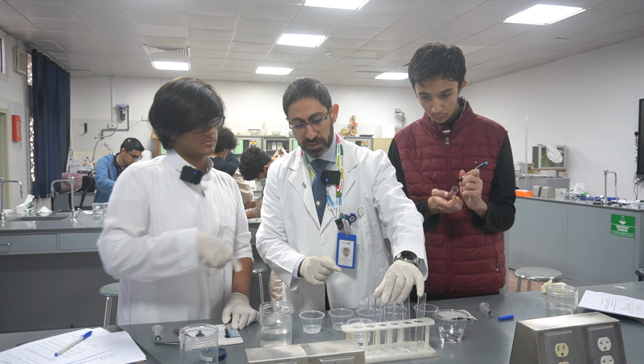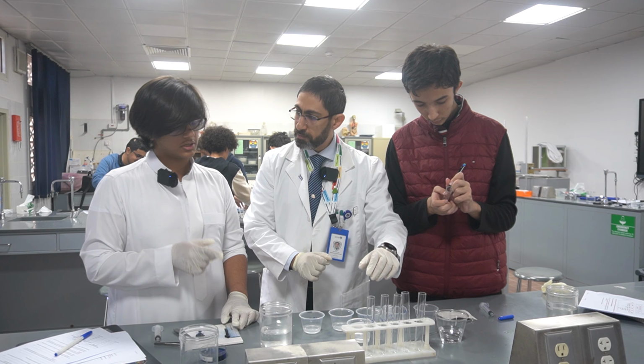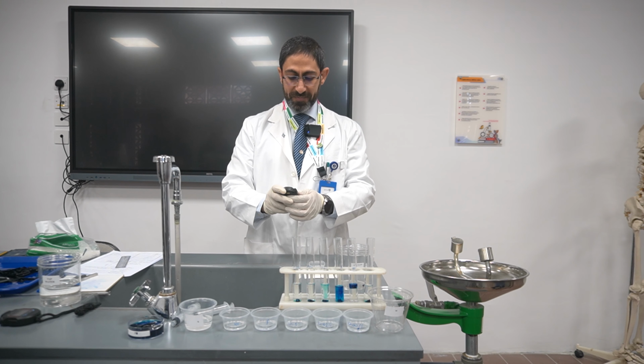How many centimeter cubes will you place in each test tube? 10 in each one. For how long will you keep it? You keep it for 10 minutes. Exactly. Thank you very much. Carry on. Thank you, Ibrahim.